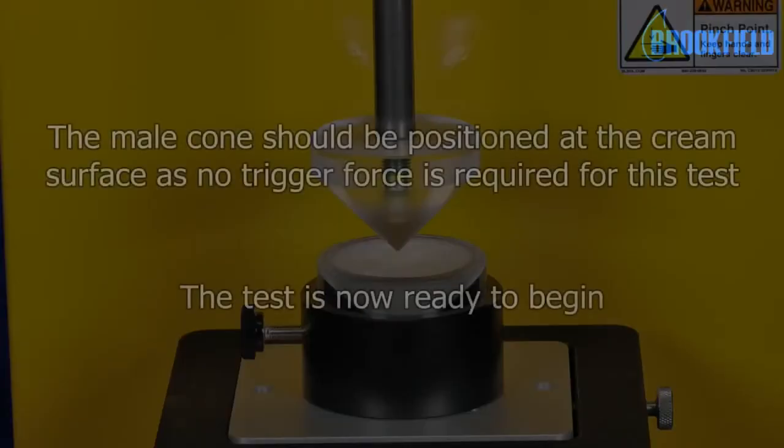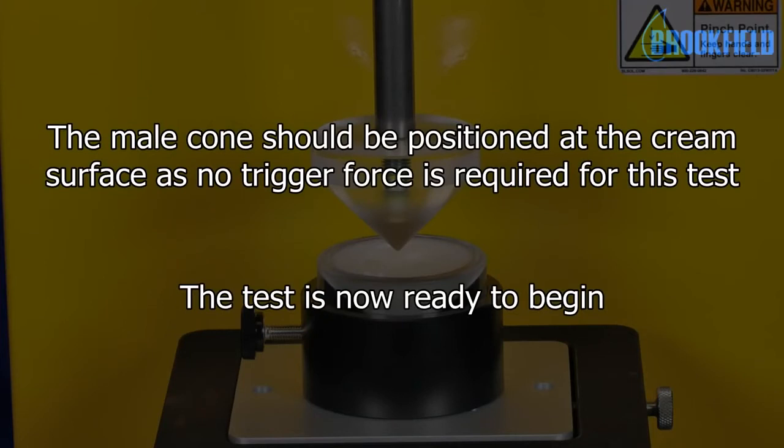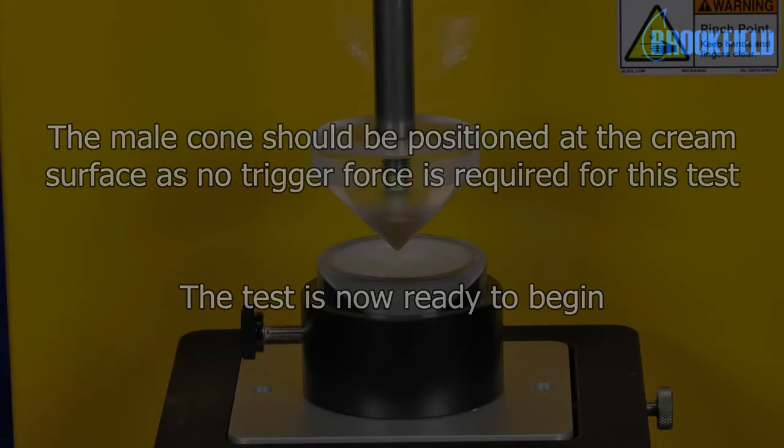The male cone should be positioned at the cream surface as no trigger force is required for this test. The test is now ready to begin.